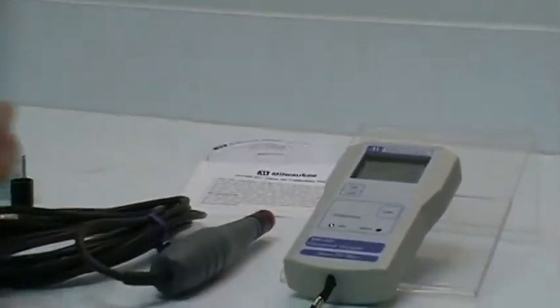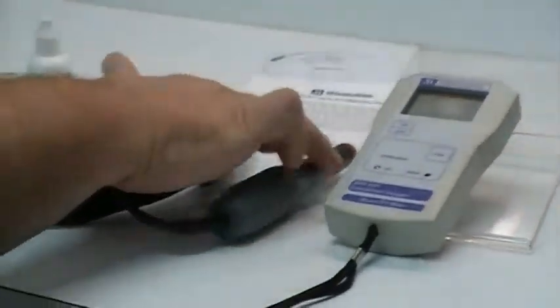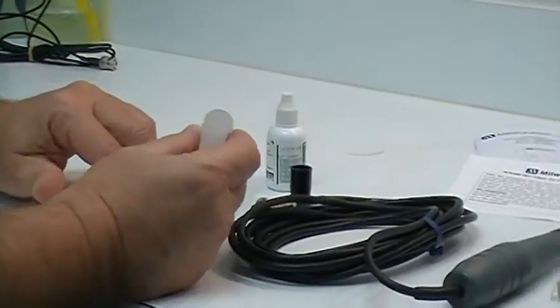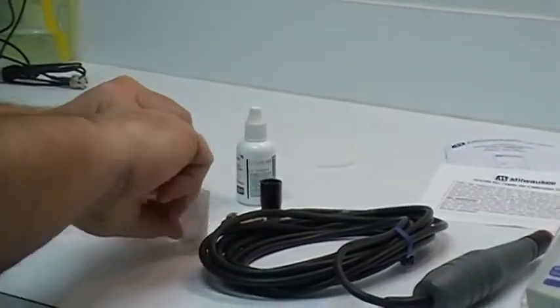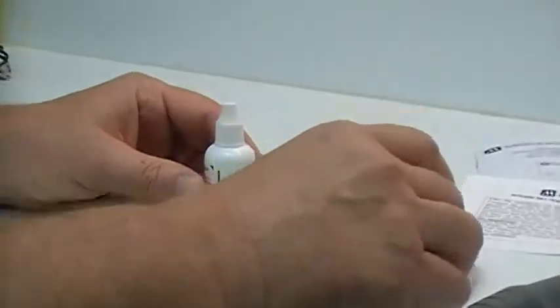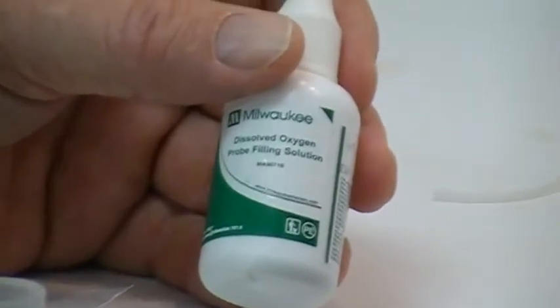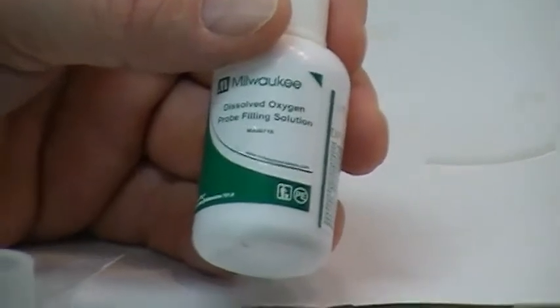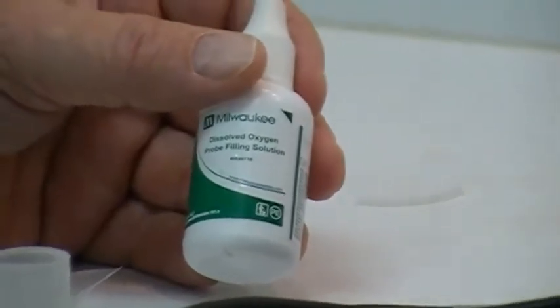When you first open up the unit, these are the parts you see. You got the base unit, we've already put the battery in. You have the probe with the protective cap on. You have a package of five membranes. In the membranes, there's also a protective cap with extra O-rings. I've already sorted out one of the membranes we're going to be using. And you have a starter bottle of MA9071-S, which stands for starter bottle, that will provide you with possibly three, maybe four refills of your membrane. At some point you're going to need to purchase additional MA9071 electrolyte solution.